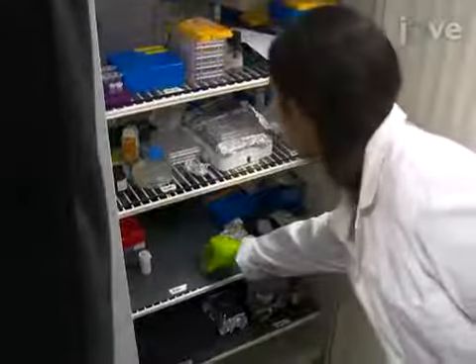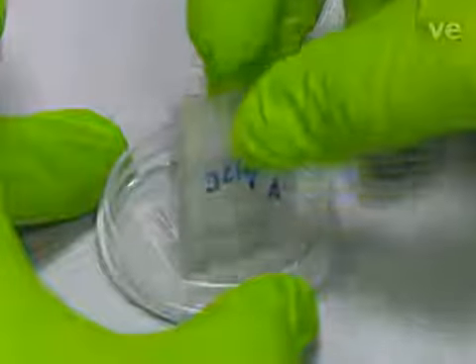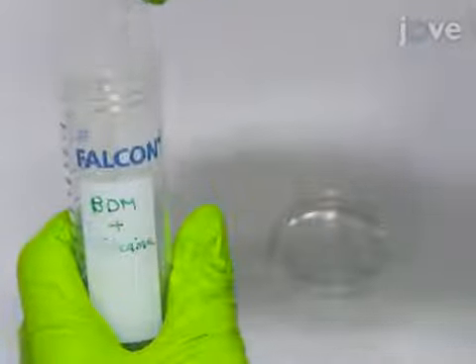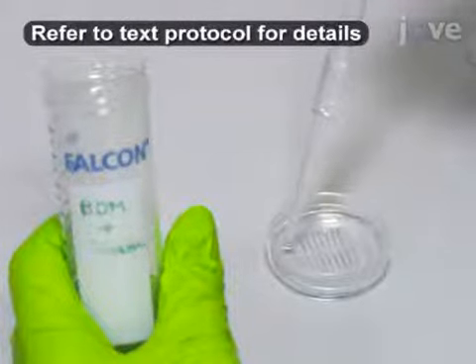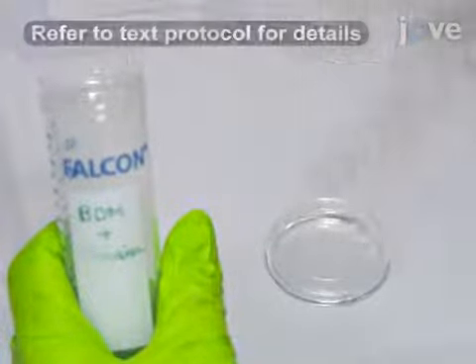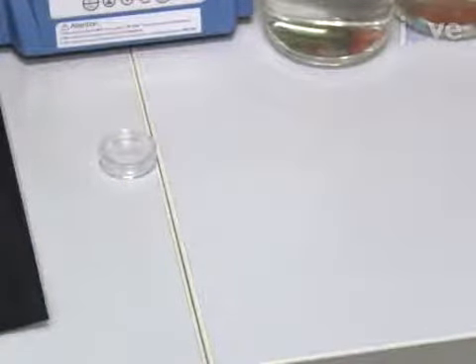Place the dish at 4 degrees Celsius until the agarose hardens. Then remove the plastic mold from the agarose. Next, add 2 milliliters of previously prepared mounting medium to the mounting dish and allow 15 to 30 minutes for the solution to diffuse into the agarose.